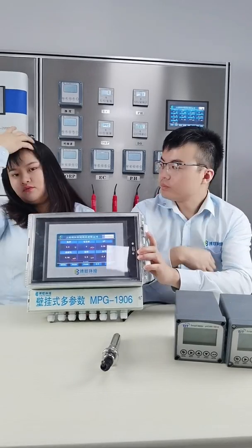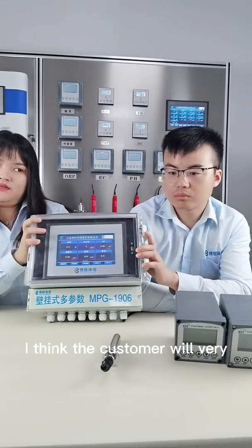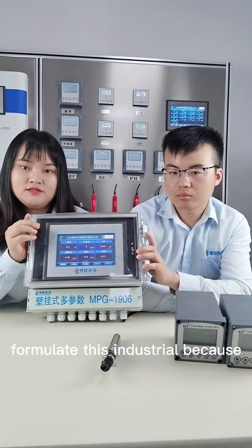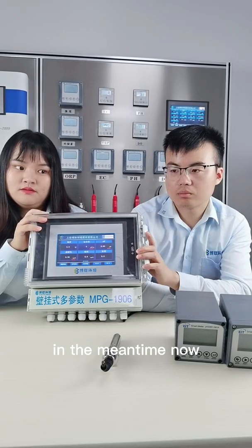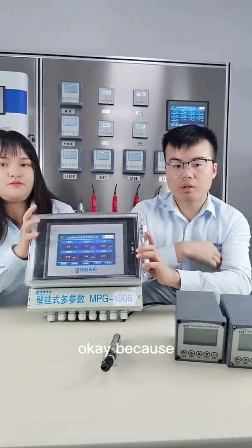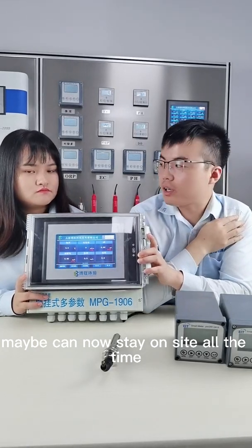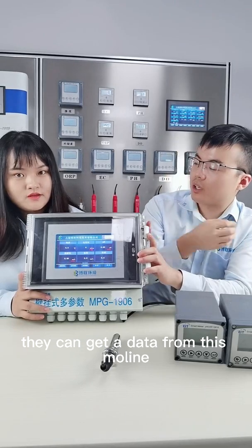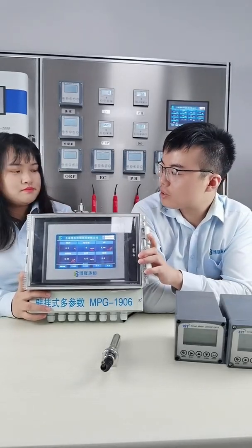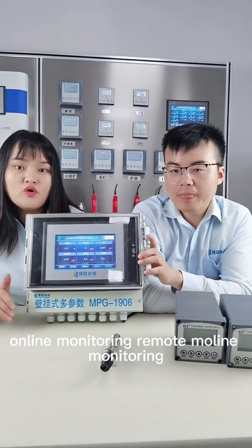Okay. We have several customers in this industry, doing IoT farms. I think the customer will be very familiar with this industry because it is very popular at the moment. Our end user maybe cannot stay on site all the time, so they want to check the data. How can they get the data online? Yes, this controller supports remote online monitoring.